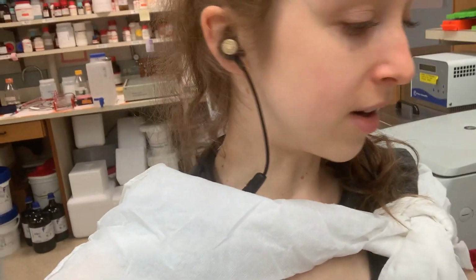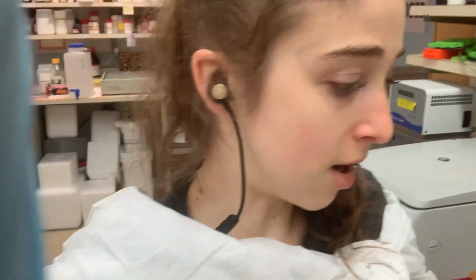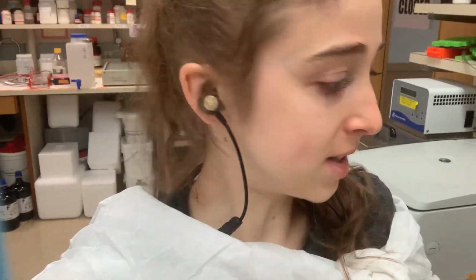Another thing: make the APS fresh and keep that in the fridge. A lot of places say to make it that day, but I've used it several months old and it still works, though maybe it would work better if it were fresher. But yeah, so that's the basics.